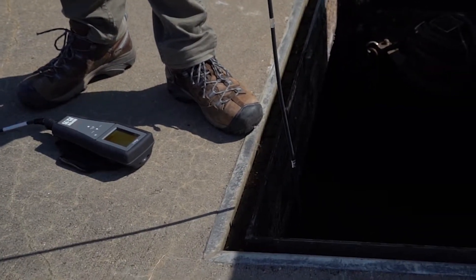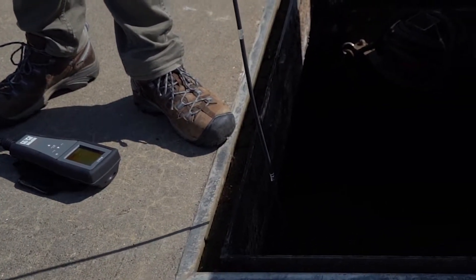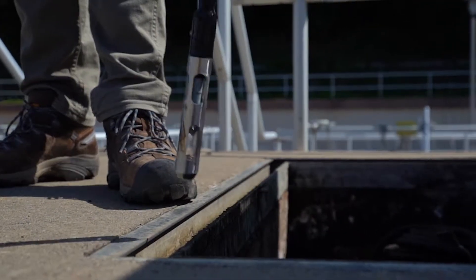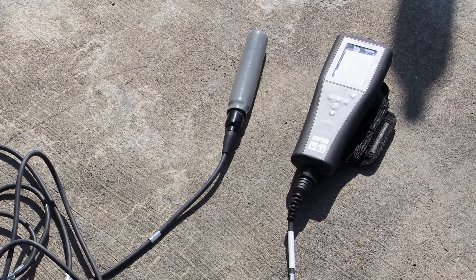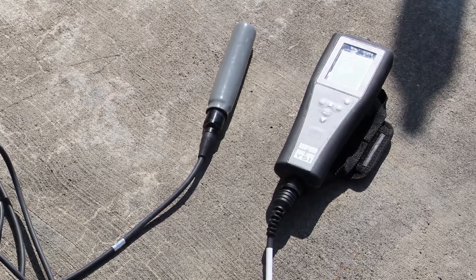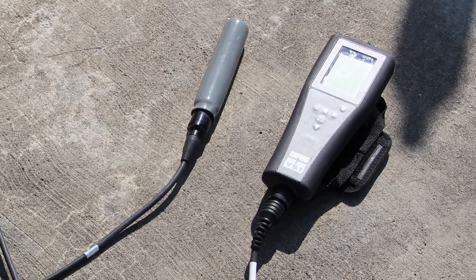So that was pretty solidly anaerobic — you're golden. It's an automatic readout on the screen, but it does do trending, so we can take it back to the office and check that on a graph as well.